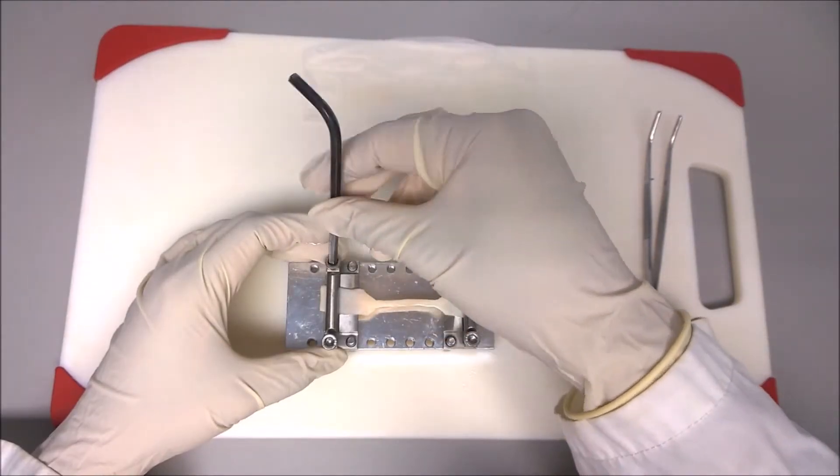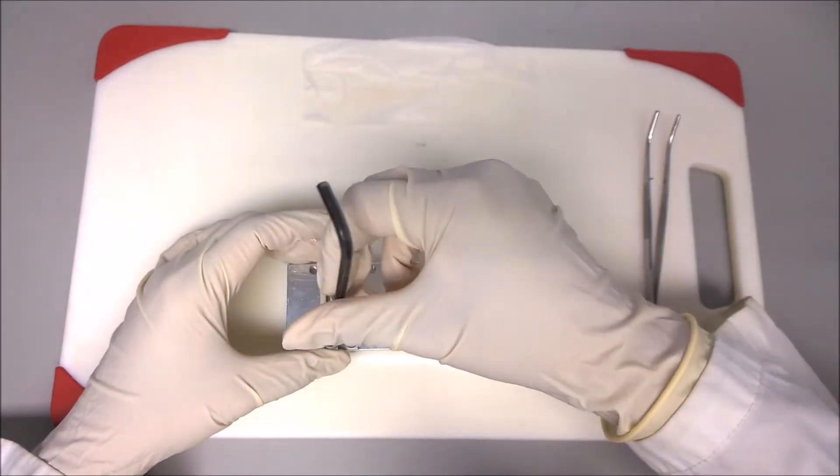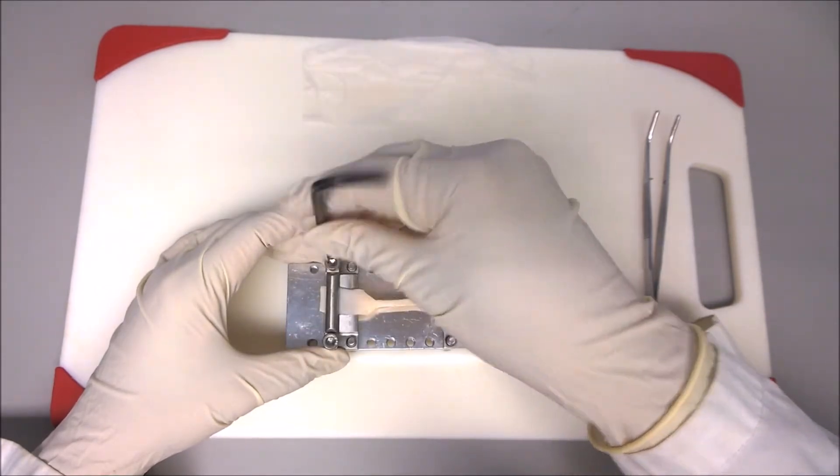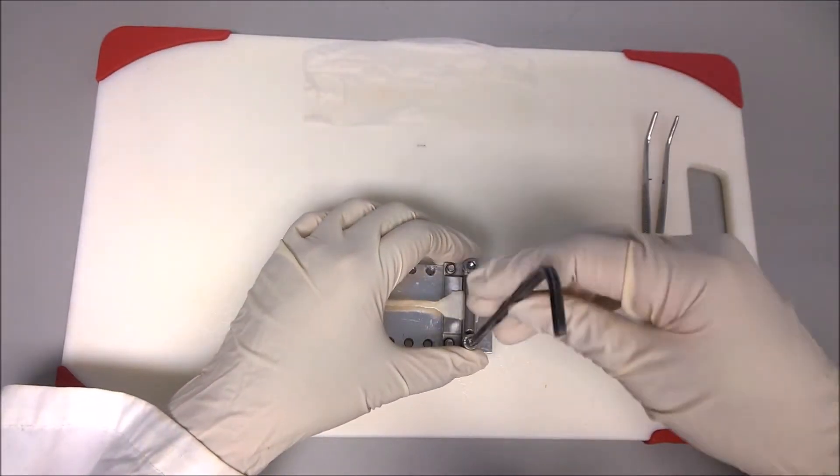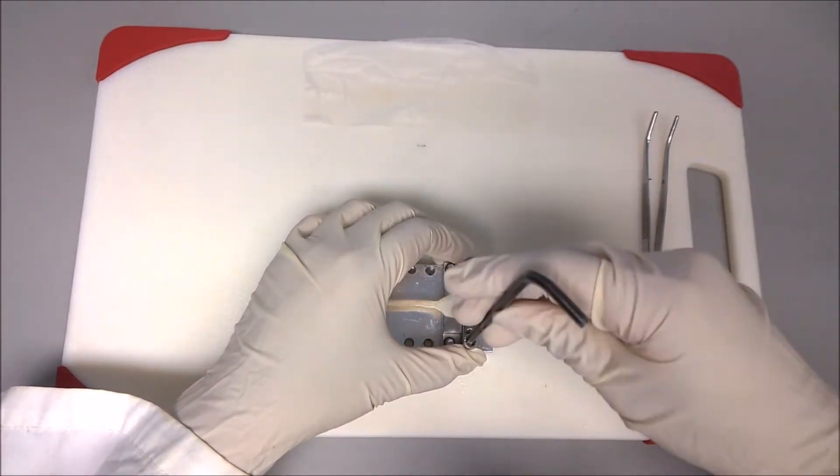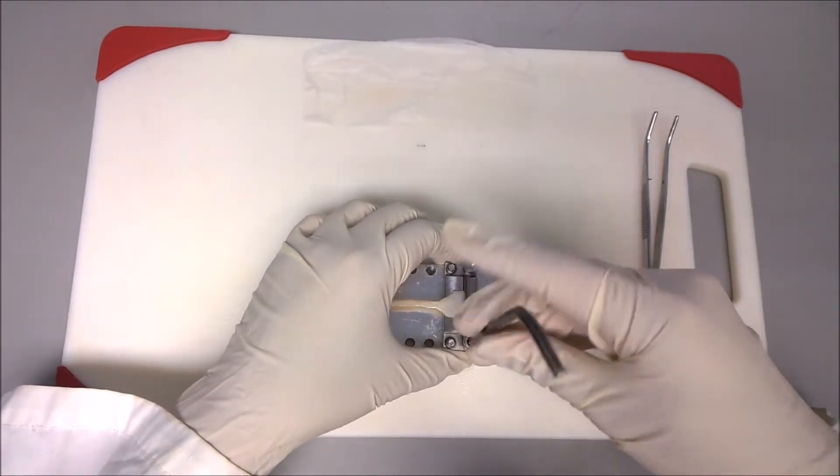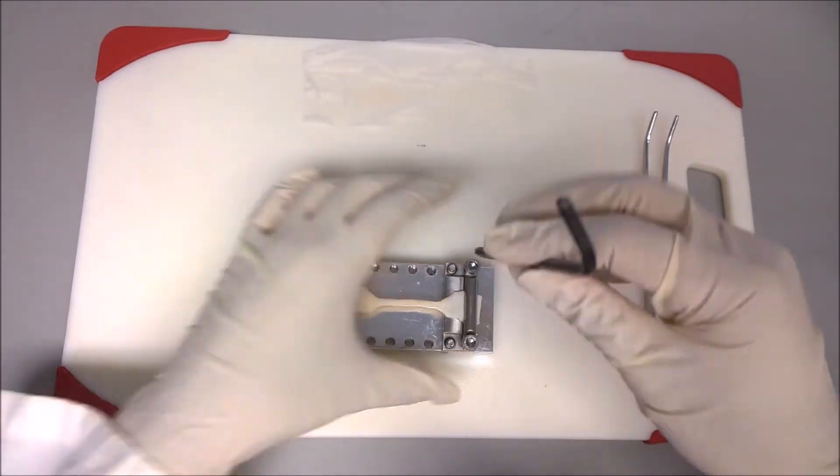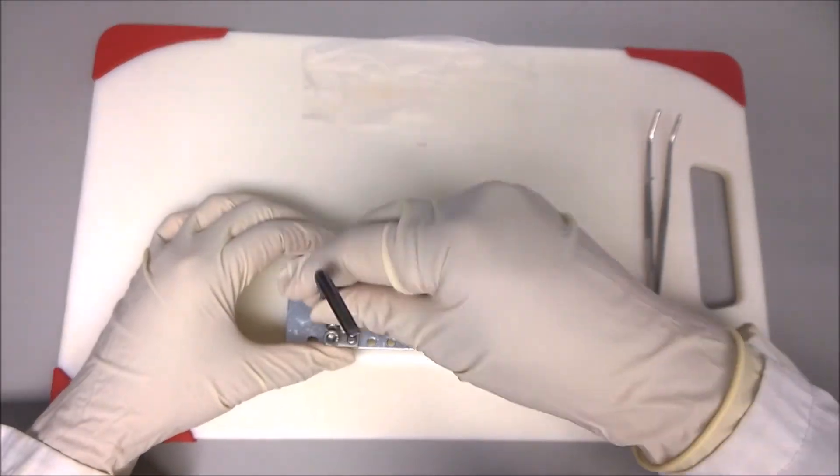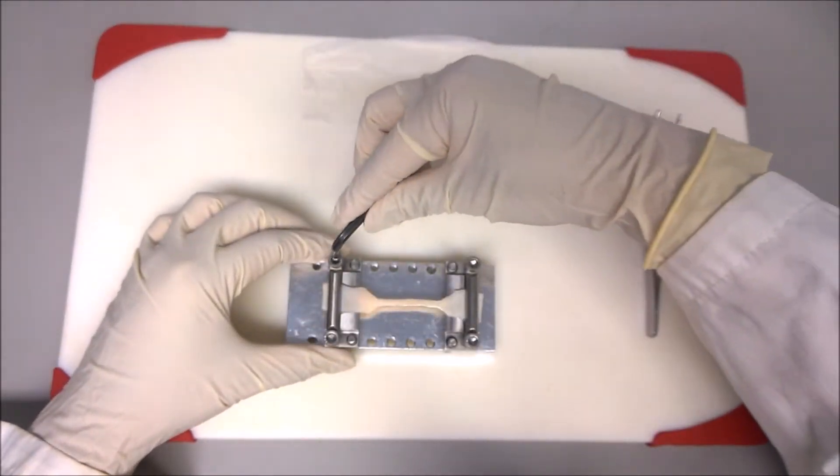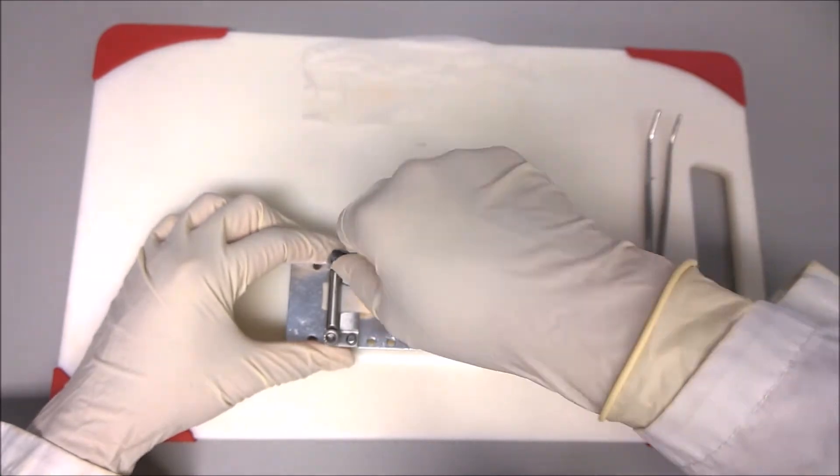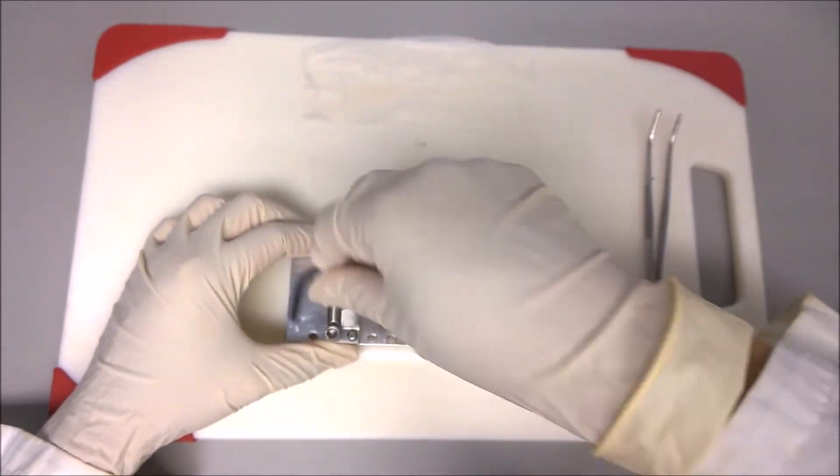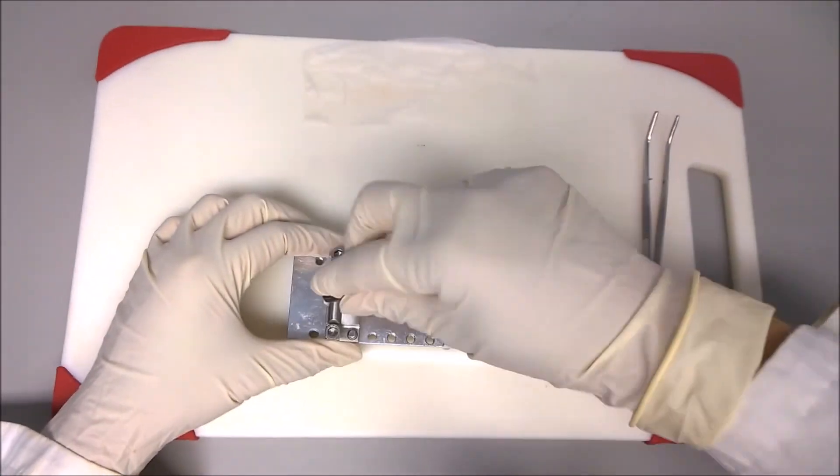Screw one cylinder on each grip by making sure that the sample is still centered and perpendicular to the tensile grips. All assembly steps must be performed cautiously so that no stress is imposed on the center region of the sample.